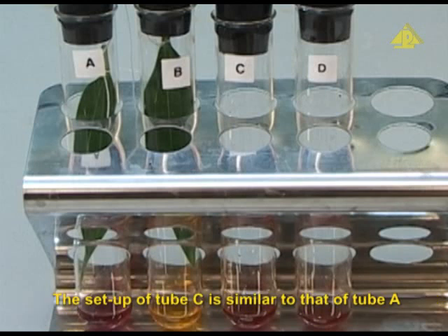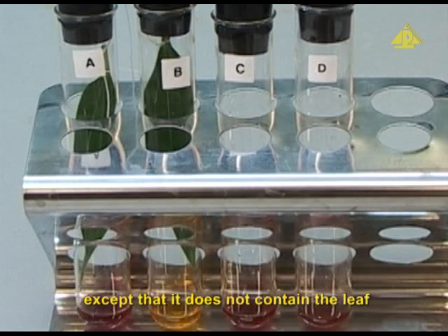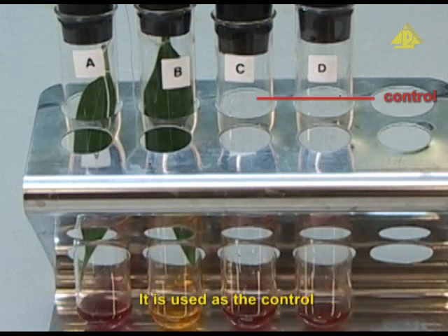The setup of tube C is similar to that of tube A, except that it does not contain the leaf. It is used as the control.